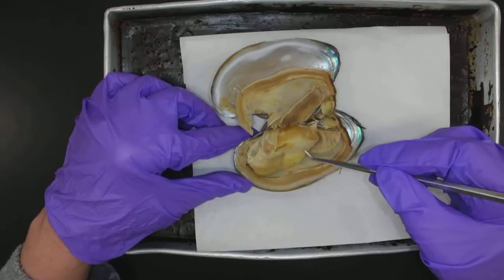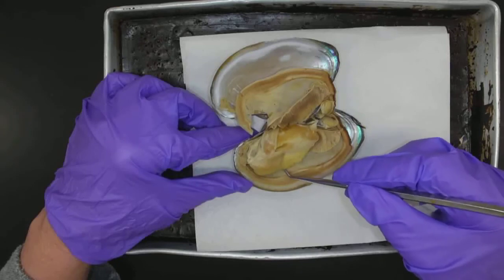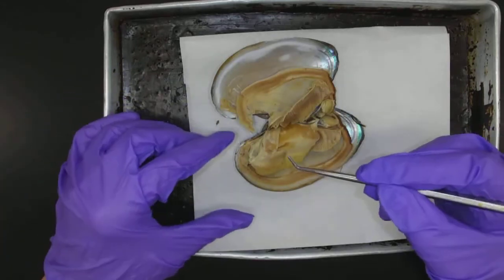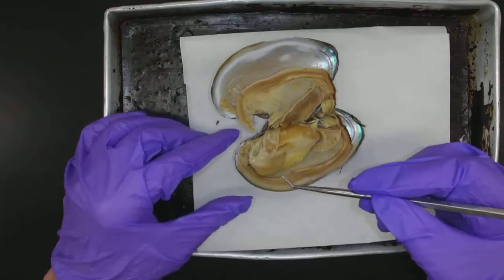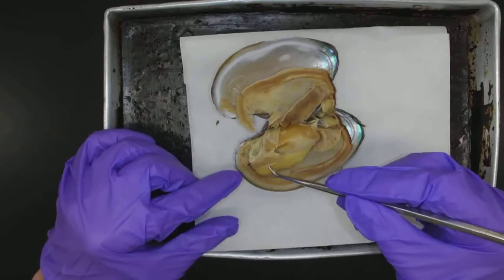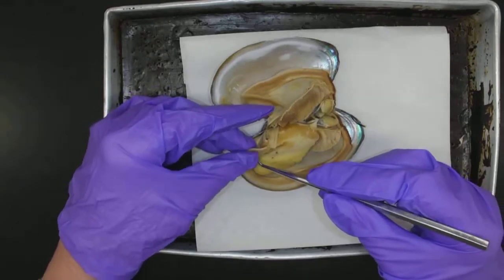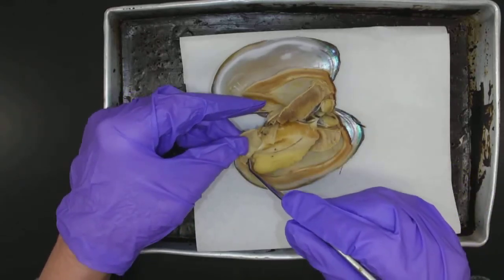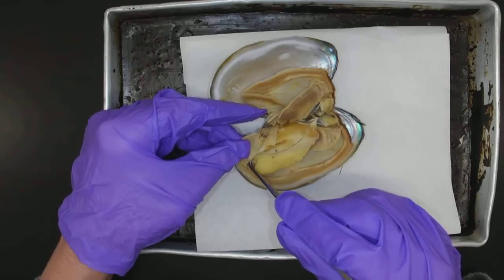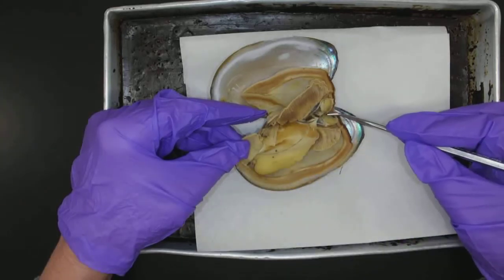This whole structure here is the foot — the muscular foot. It makes razor clams, which can be quite fast and hard to catch, believe it or not, while other clams you can walk over and pick up. This part here is called the labial palp, and that is responsible for getting food into the mouth. The mouth is located up in here — it's an opening here. The anus is going to be on this side.